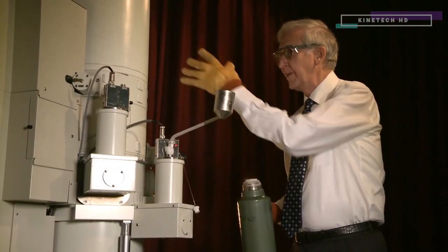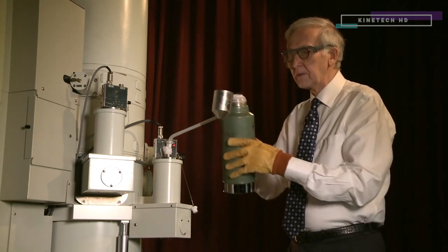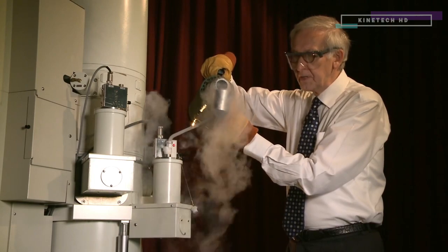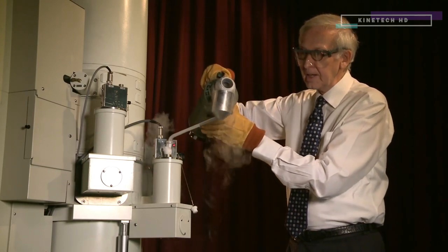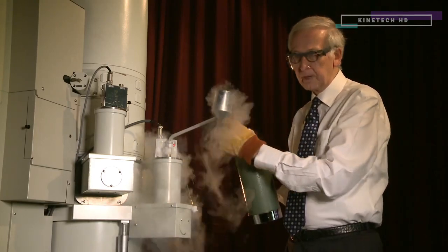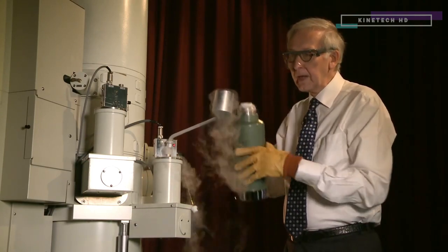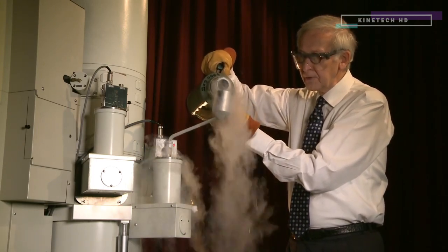This electron microscope has a vacuum in the column, otherwise the electrons would get scattered by the air molecules. To improve the vacuum, we're going to pour in this liquid nitrogen. Around the specimen there's something called a cold finger, because it's very cold. The main problem with the vacuum, although it's a very good vacuum, is that it contains a lot of water vapour. The water vapour condenses on this cold finger and not on the specimen, because the specimen is at room temperature, and this improves the vacuum by a factor of ten times, which then improves the images you get.